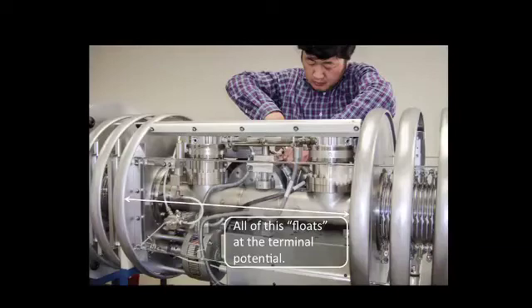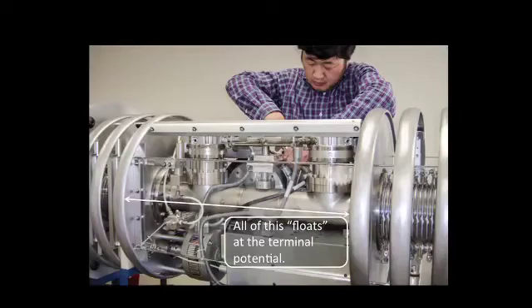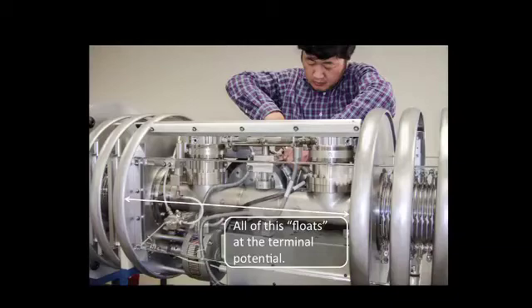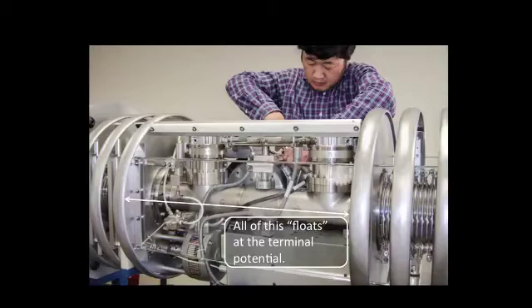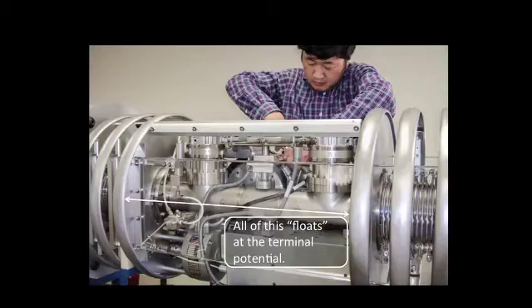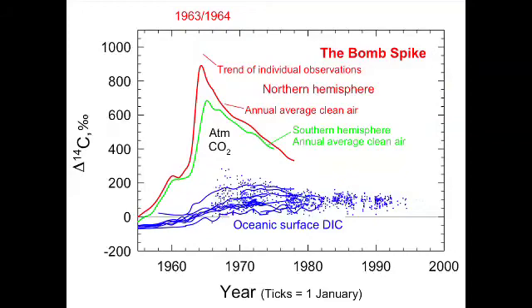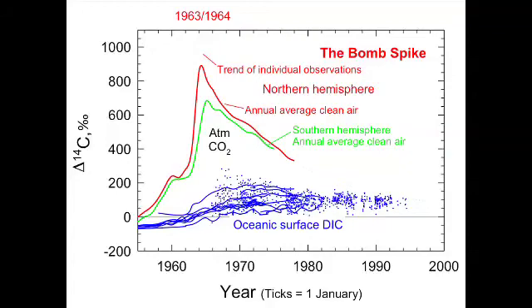The interesting thing is that this whole assembly has to float 2.5 million volts above ground potential, which means you need to power these turbo pumps that are floating 2.5 million volts above ground — so you just can't plug them into the wall. You have to have a generator that also floats 2.5 million volts above ground. You turn the generator by having a Teflon shaft that runs from here out to there, and you've got a motor that you do plug into the wall. The motor turns the Teflon shaft, the Teflon shaft runs the generator, and you produce 110 volts at 2.5 million volts above ground.